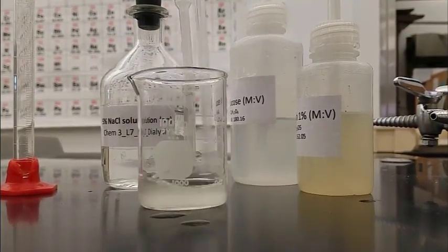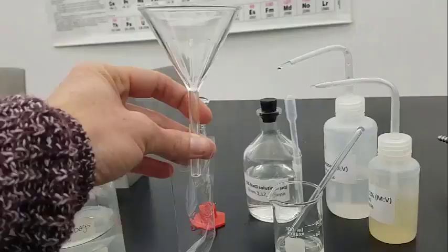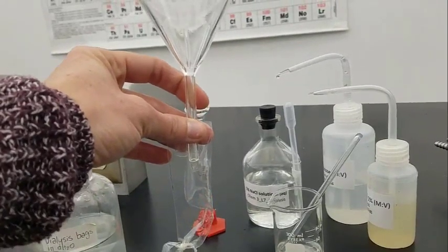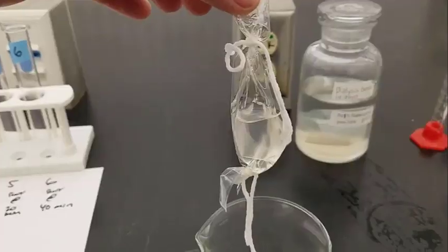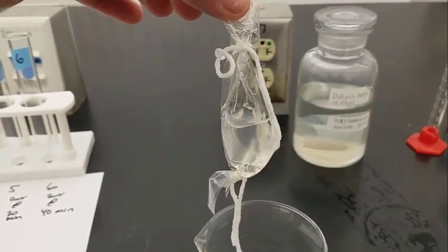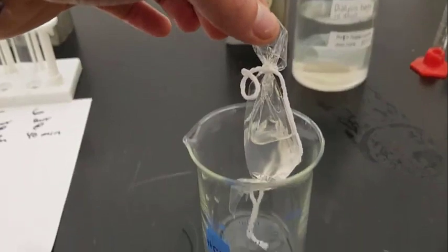This is our mock blood. It's not red, but you can pretend. We're going to take that mock blood and pour it into a dialysis tube that has semi-permeable holes in it. Tie it up nice and tight.